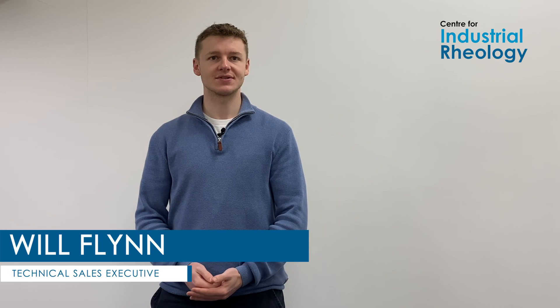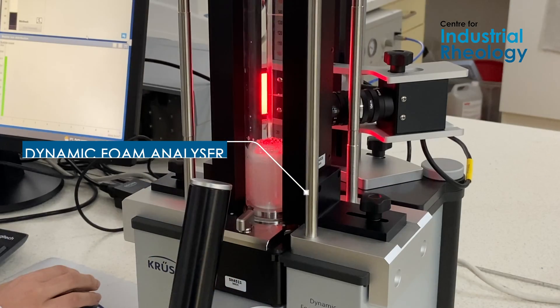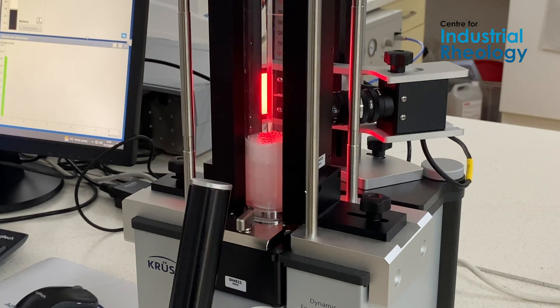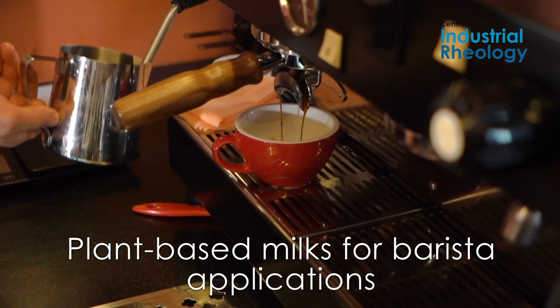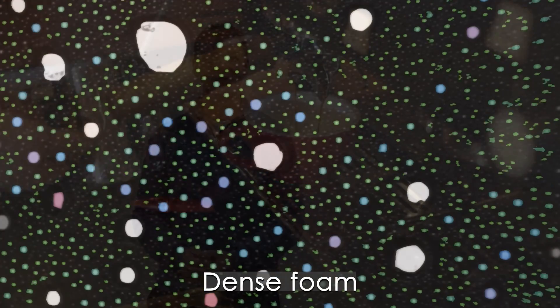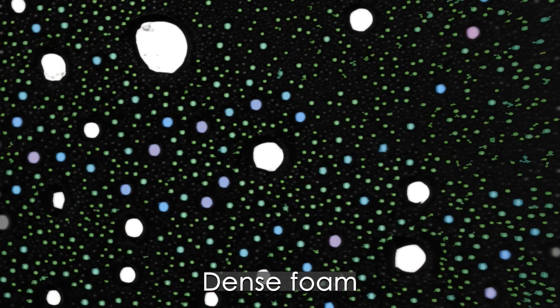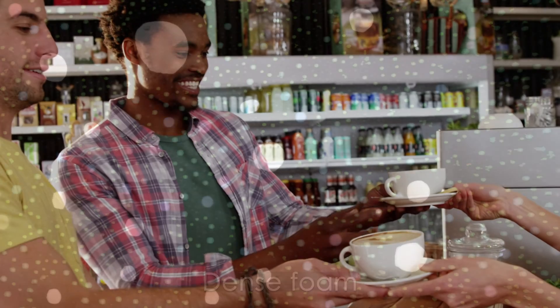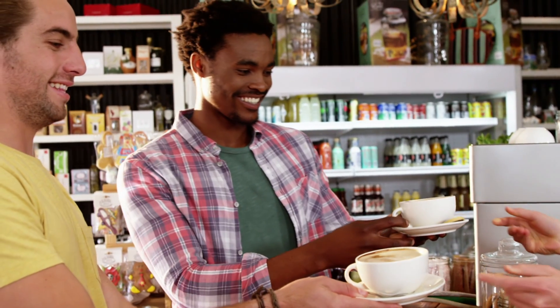Here at the lab I spend a lot of my time discussing the challenges and aspirations that our customers face. With regards to the foam analyser, we have seen a lot of interest regarding plant-based milks for barista applications. Dense, stable, uniform foams with a high liquid content appear to be desirable from the consumer perspective.